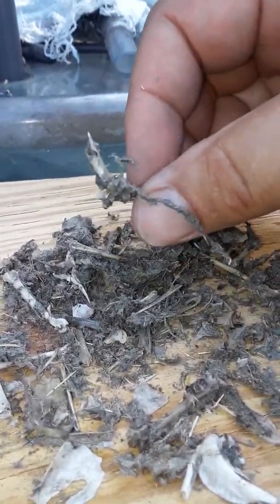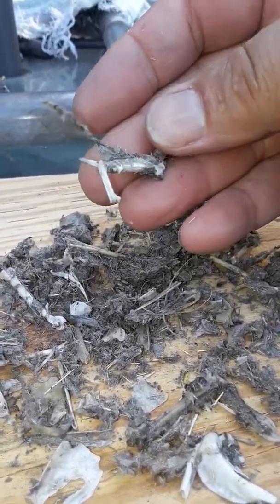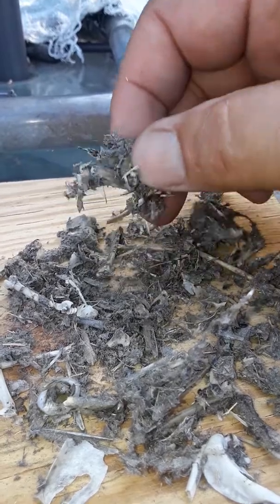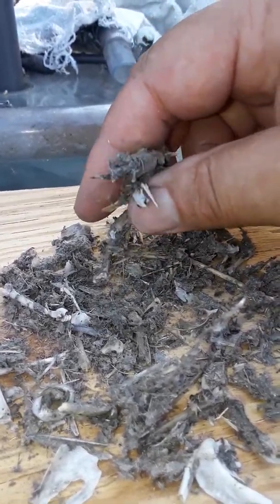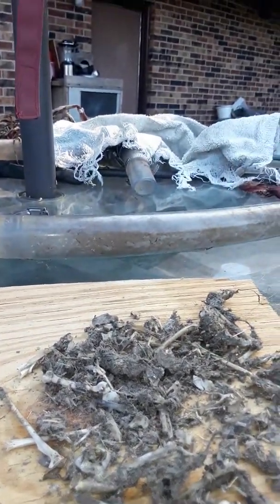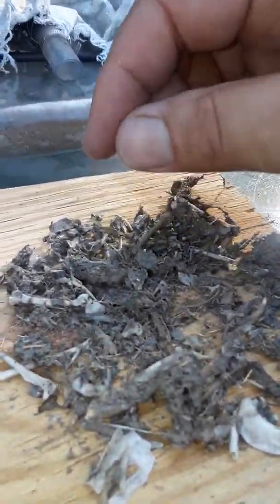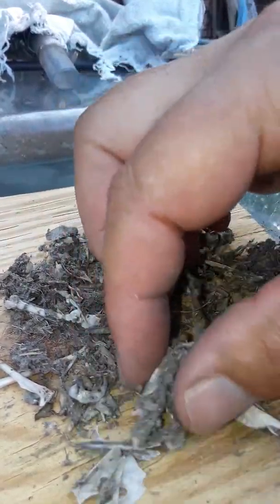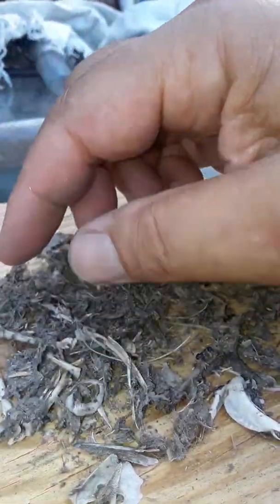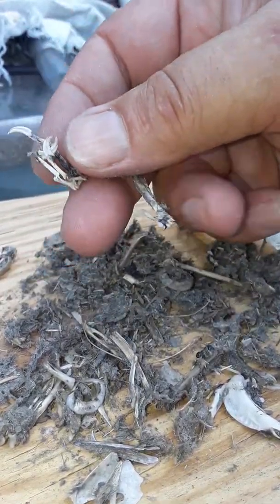Oh, there's a beak. That looks really purple martin-ish to me — that beak. I was hoping the owl that was here was not eating these birds, but it looks like he may have been.